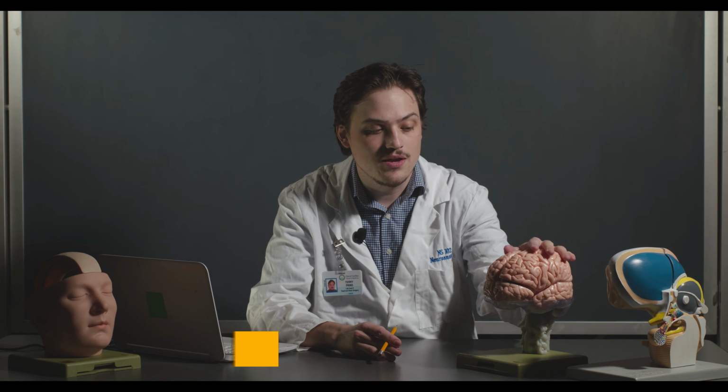Today we're going to be talking about the thalamus and the basal ganglia mostly, and we will be looking at those structures on both a human brain model and a thalamus model, as well as doing an actual dissection with the sheep brain. It'll be a little bit similar to the first lab you went through where we did a sheep brain dissection, but instead of making a mid-sagittal cut to start and coronal cuts, we're going to make axial cuts and get to these deep brain structures. I'll show you what type of cuts we're going to make as we go through it with the human models, and then we'll jump into the dissection.